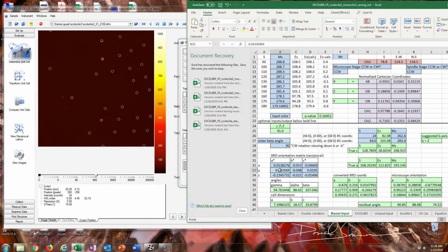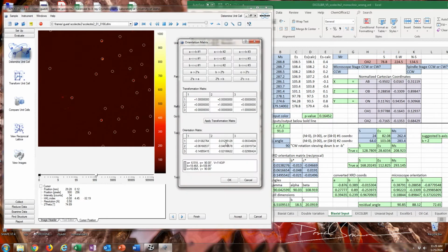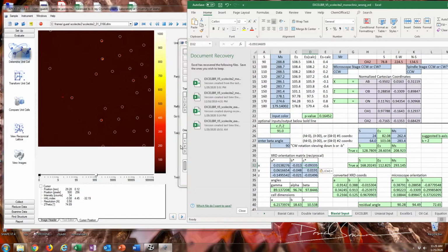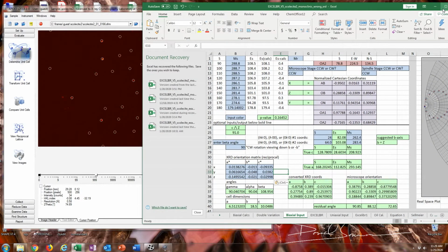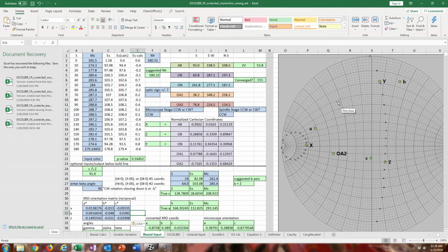But at the very least, what I could tell is that there's probably a setting that's very close to that orthorhombic one that we could use, where that C axis was equal to Z. I'm almost certain that that has to be B, the twofold axis. So Z is probably equal to B, which is also what's suggested in the spreadsheet from our work from earlier. And B is over here by Y.